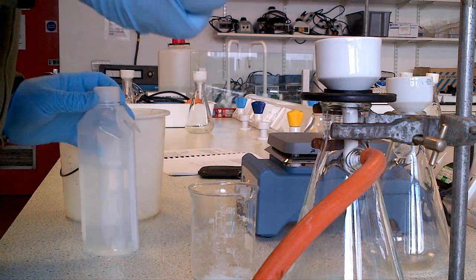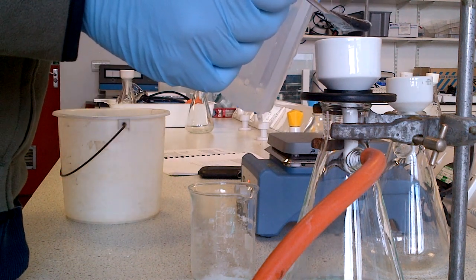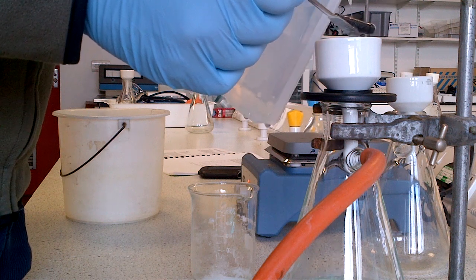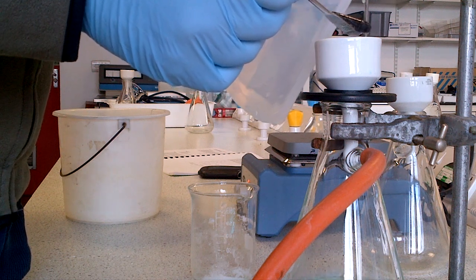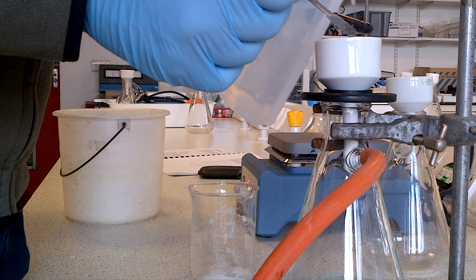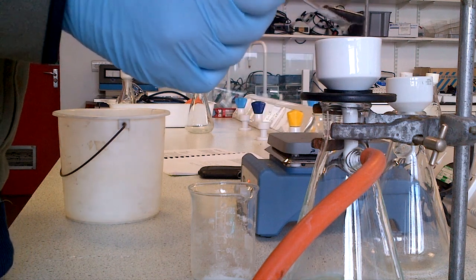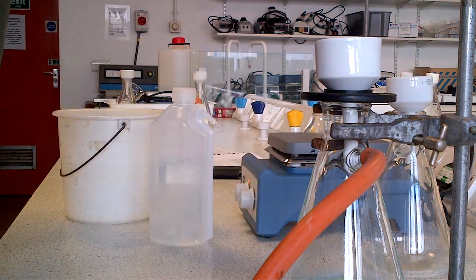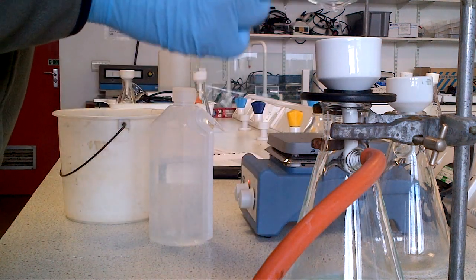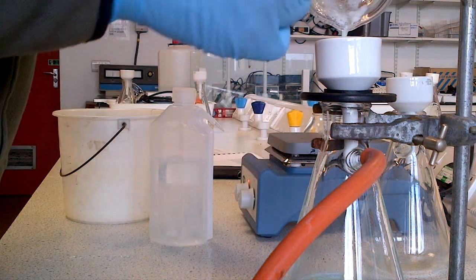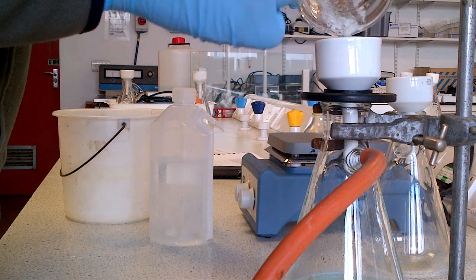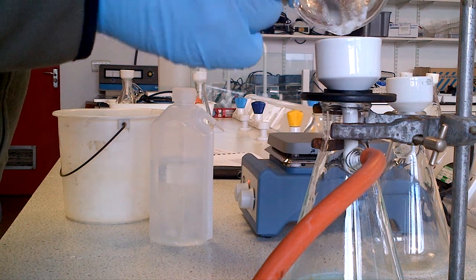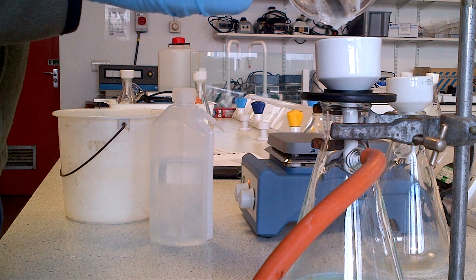It's got some crystals of salicylic acid on it, so I now shall take some of my water and wash the flea and the edge of the spatula with the cool solution of water. I take my spatula or stirring rod and now try to scrape as many crystals of salicylic acid into the funnel as possible.